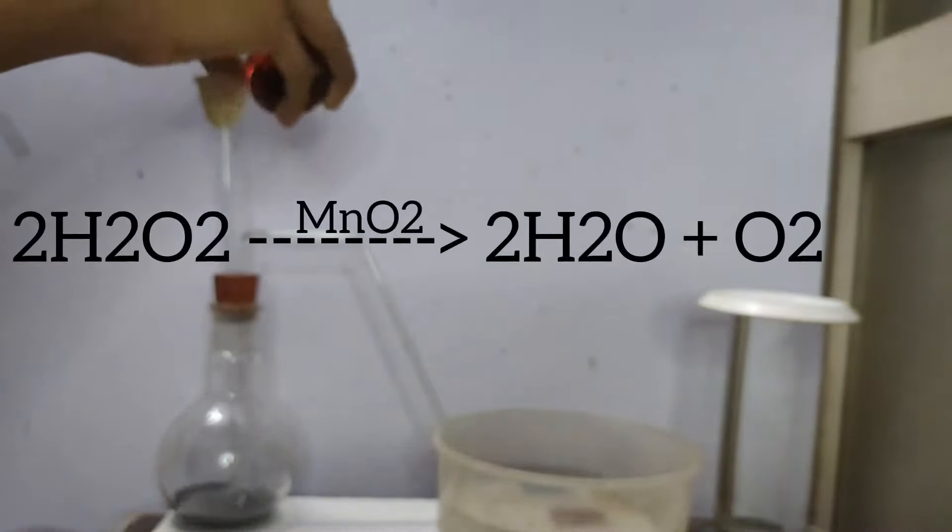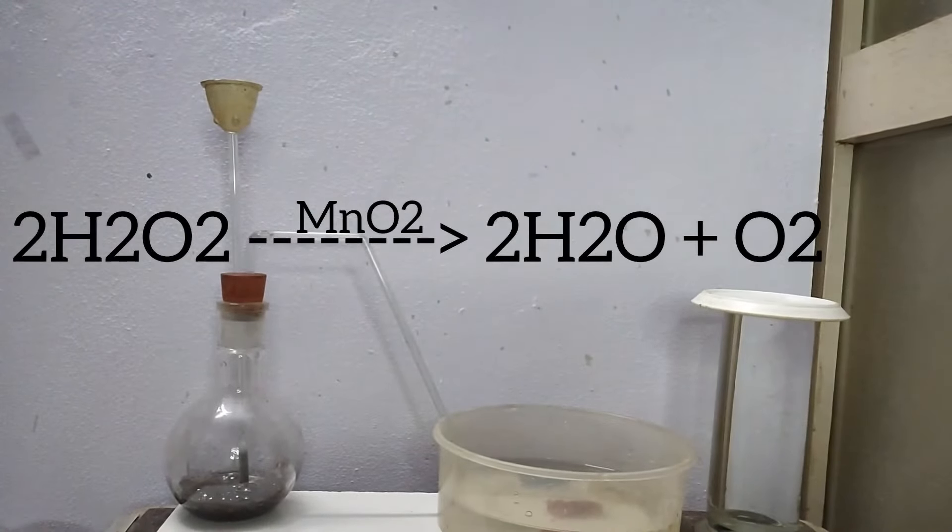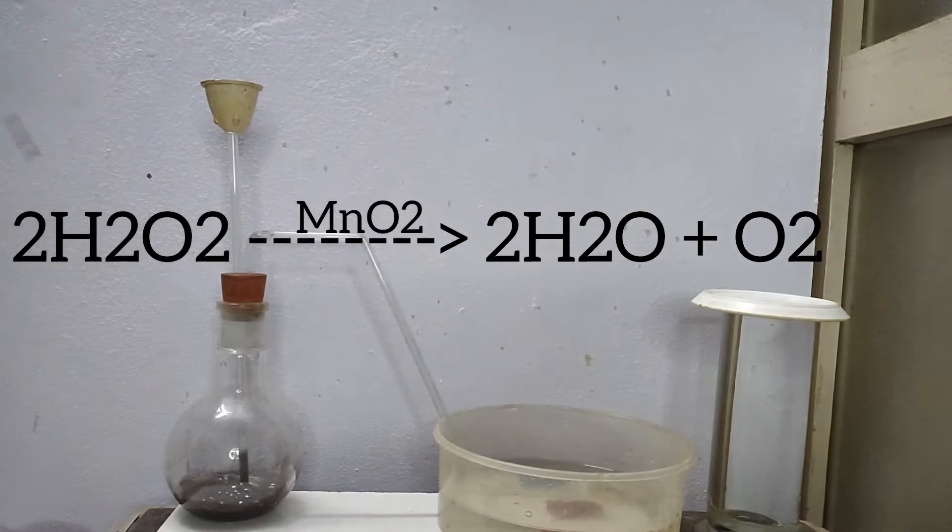You can see, according to the reaction, hydrogen peroxide decomposes into water and oxygen. Here manganese dioxide acts as the catalyst.